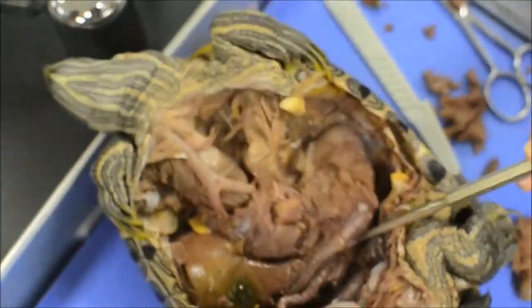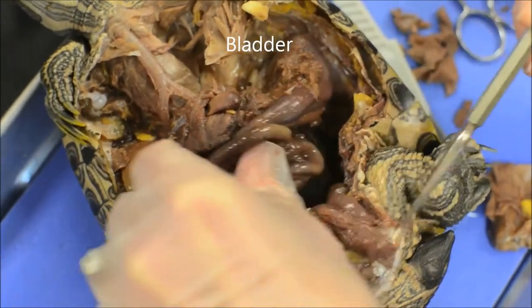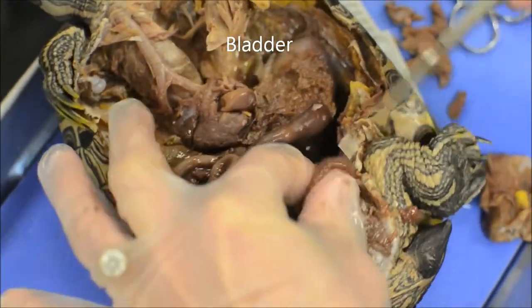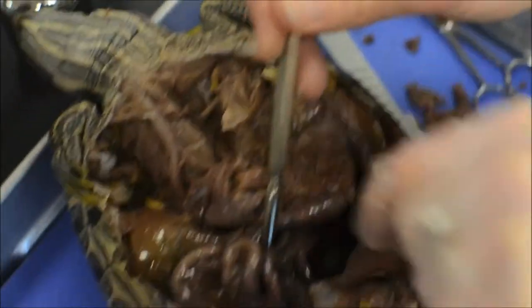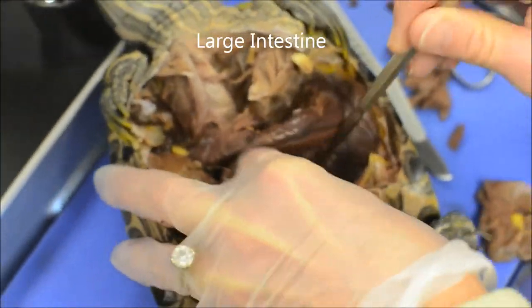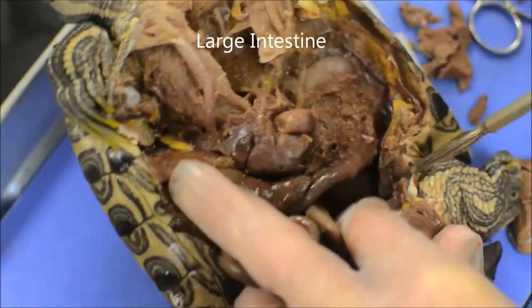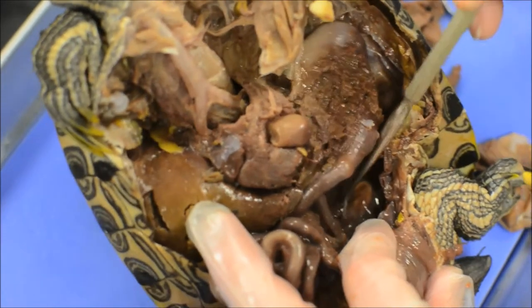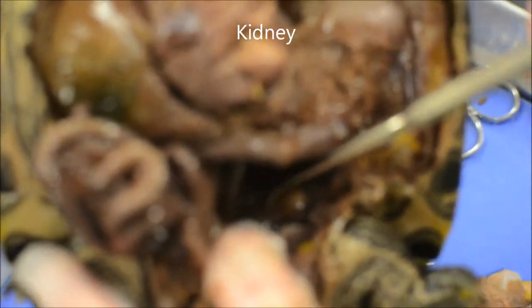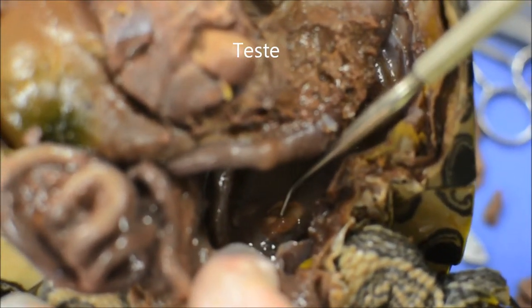This is all small intestine. Here's the bladder — the bladder is right here; it was probably filled with fluid at some point. In the back here is the large intestine along the back. Here is a kidney — the black structure way back here is the kidney. And then you have a testis right there. Okay, that's it.